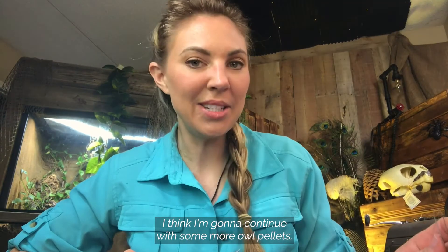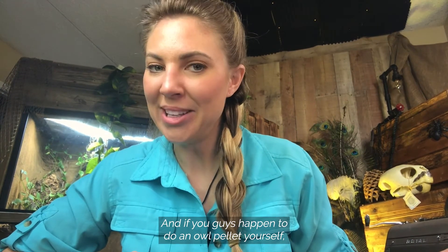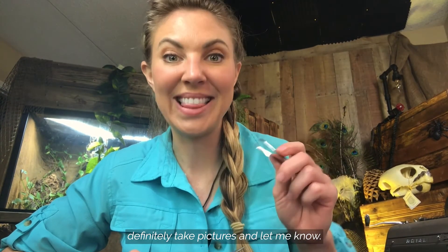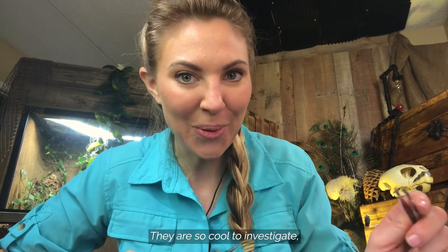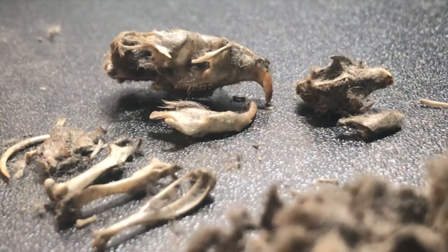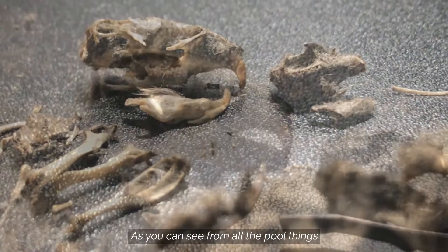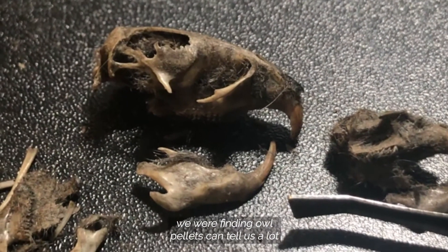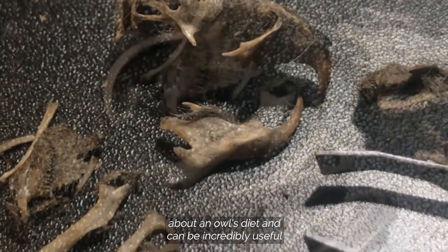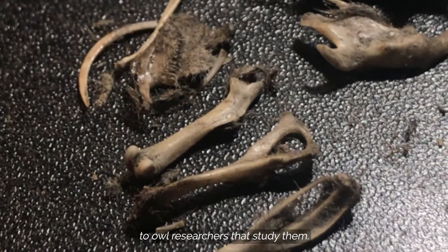I'm going to continue with some more owl pellets, and if you guys happen to do an owl pellet yourself, definitely take pictures and let me know. They are so cool to investigate and we can learn so much. As you can see from all the cool things we are finding, owl pellets can tell us a lot about an owl's diet and can be incredibly useful to owl researchers that study them.